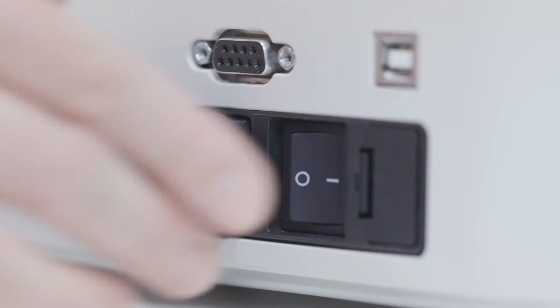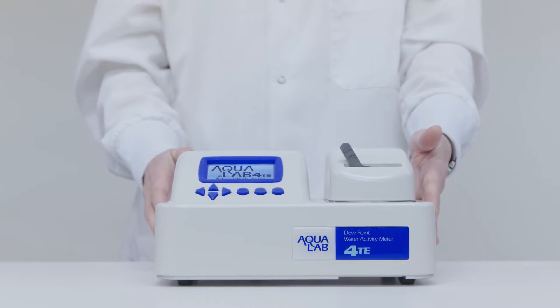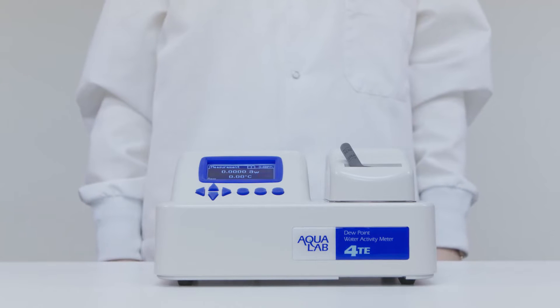Plug the Aqualab in and turn it on. You'll hear fans starting up. The fans keep the block temperature as stable as possible. Please let your instrument warm up for 15 minutes.